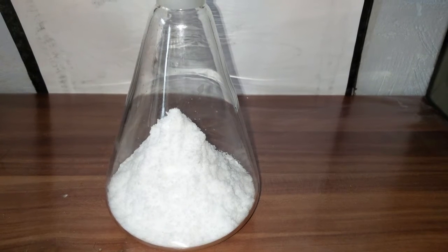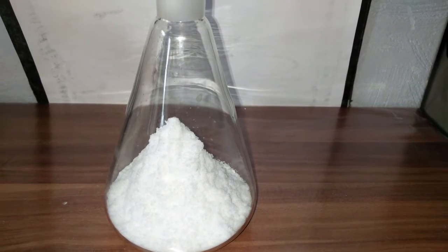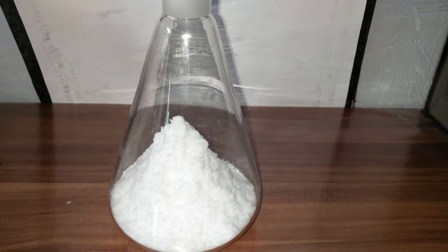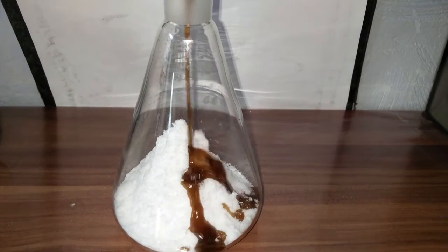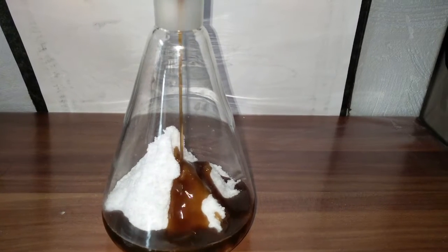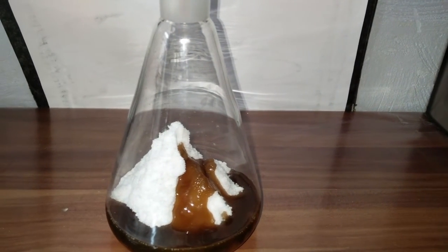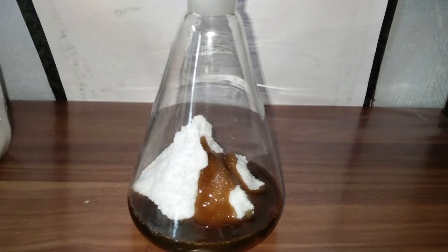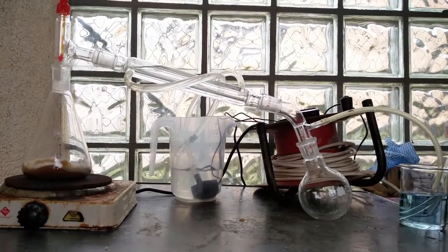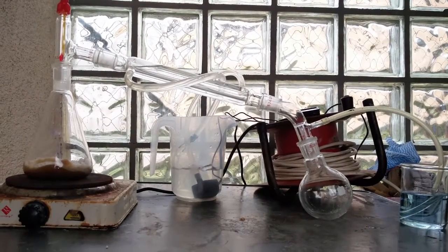We start by weighing out 100 grams of oxalic acid dihydrate. Note that you can't use water-free oxalic acid, since water is needed in the reaction. To this we add about 50 grams of glycerin. I also add some sand, which will lead to even boiling and also helps the reaction forming our acid.